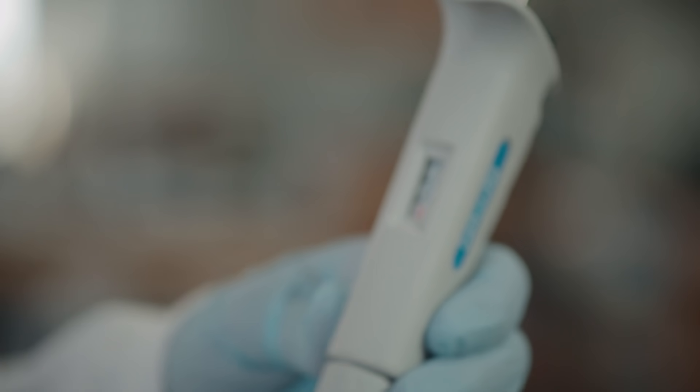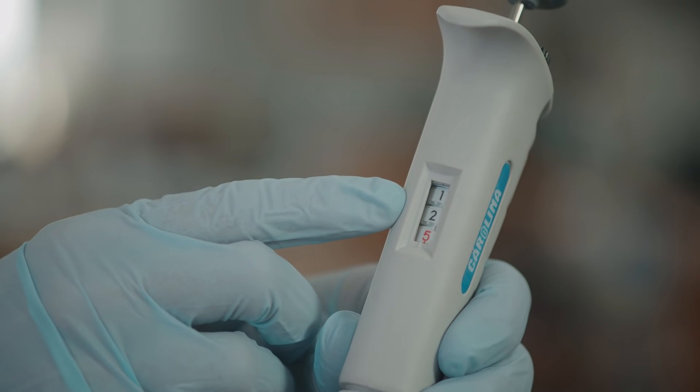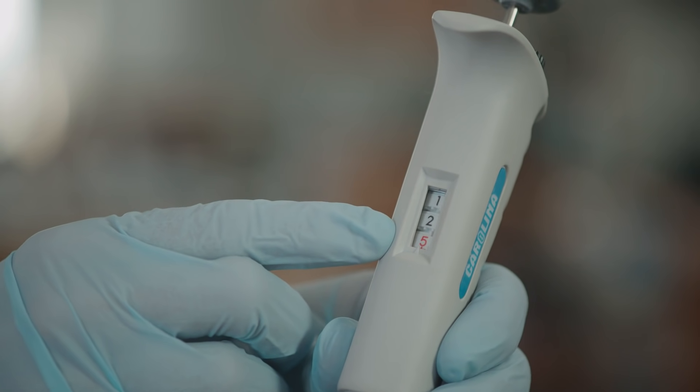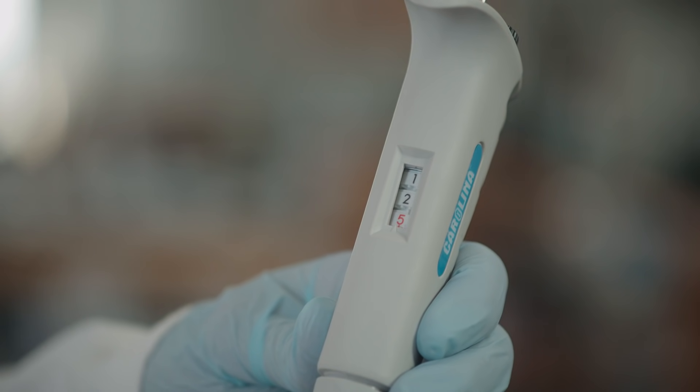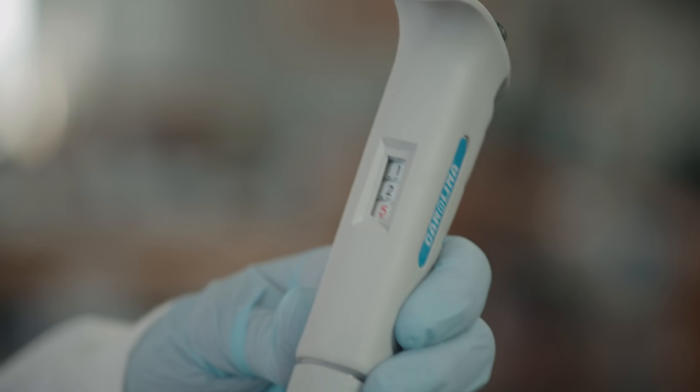For this P20, the top digit represents the tens place. The next digit down represents the ones place. The digit on the bottom in red represents tenths. This micro pipette is set to take up 12.5 microliters.